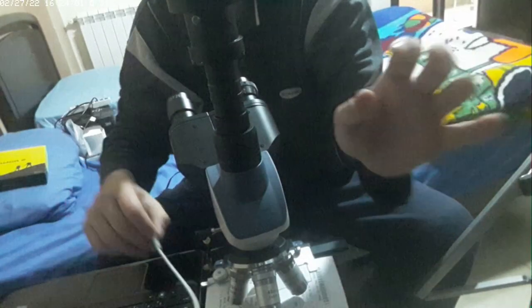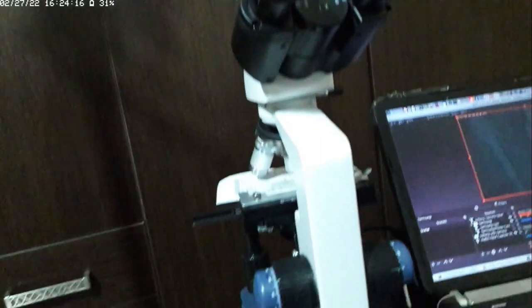Now what you're going to do is use this. Let me remove the charger for the phone. This is the whole thing. I've switched the camera to the other side. This is the whole thing, see from the back. This is me using the eyepiece. I'll have to turn on the light underneath the lenses. I am using a receipt paper. See, yes, this is it.